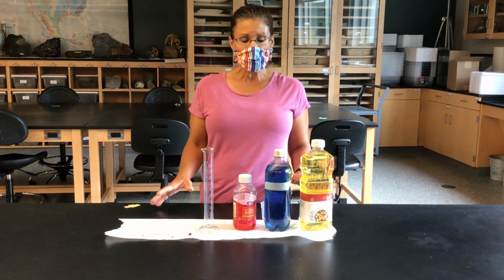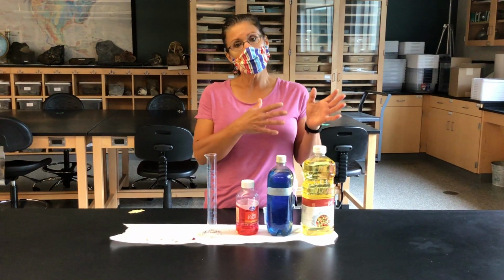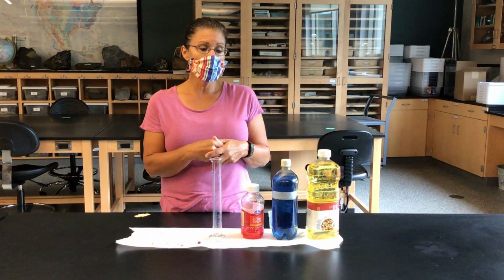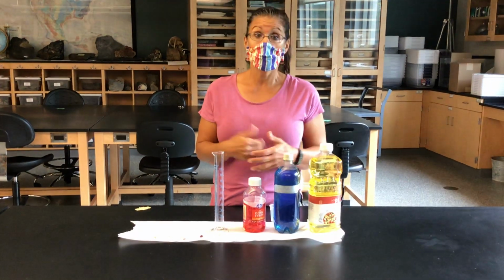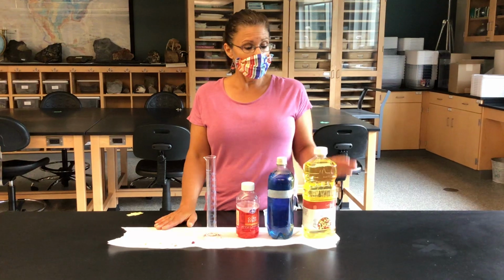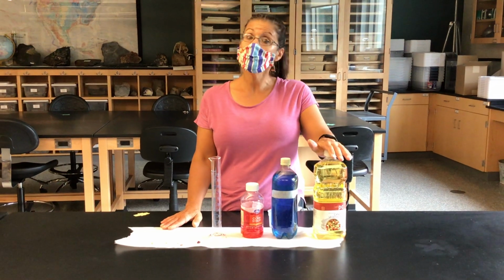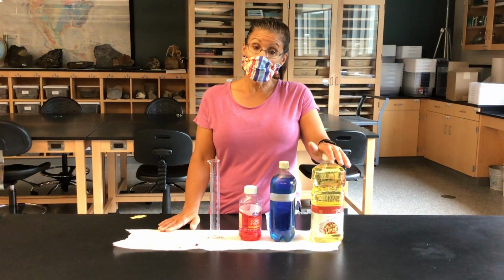So what I'm going to do is give an explanation of the procedure, we'll walk through it, and then you'll be answering questions related to what I'm demonstrating to you, and then you may be doing some hands-on work at home as well. So let me start by explaining the fluids that we have here today. And our first question, our first hypothesis, is what will happen if we mix three fluids together?